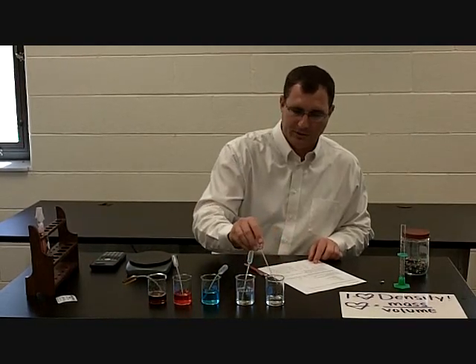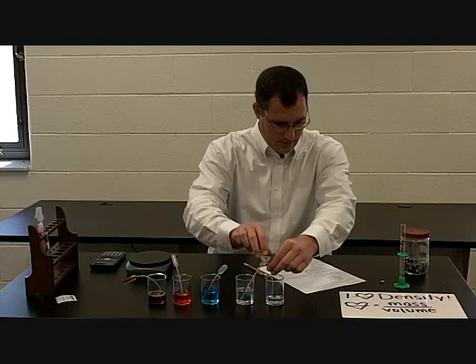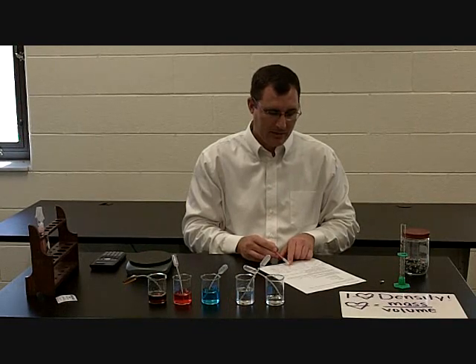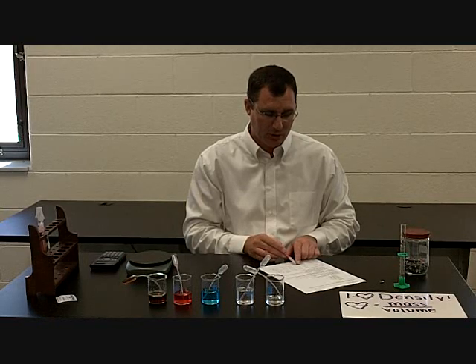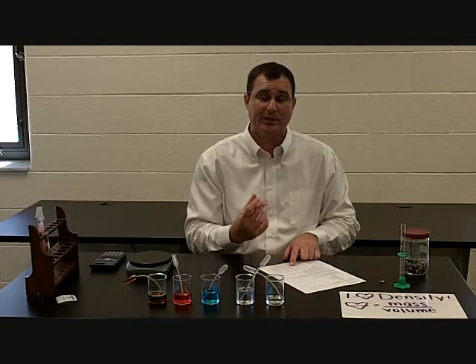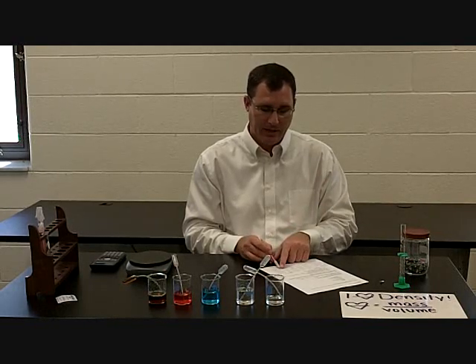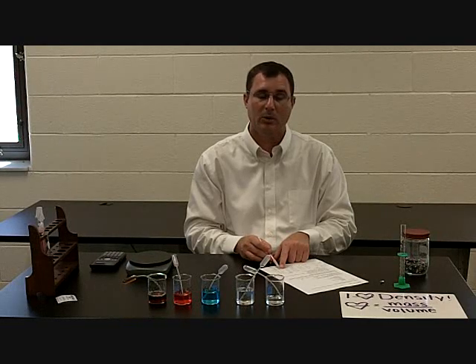The first additional fluid is isopropyl alcohol. I fill the pipette all the way up, and it weighs 4.7 grams. I subtract the pipette mass of 0.9 grams, giving me 3.8 grams for the actual isopropyl alcohol. I divide by 4.8 milliliters, and that gives me a density of 0.79 grams per milliliter.